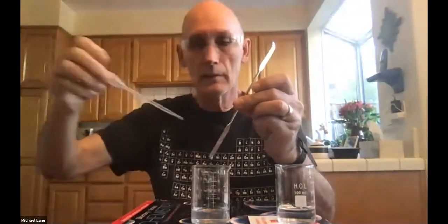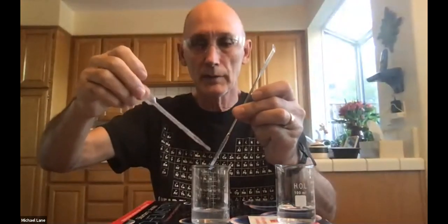Now again, I've got some sodium carbonate that's in that solution. And since everything is based on mass measurements, I want to make certain that I get everything into the beaker that I started with. Okay, start over here. And again, I should have done that. Let me do it now. This is, of course, the sodium carbonate. Now, frankly, I don't recall in the procedure which one it says to add to the other. I can't see that it makes any difference whatsoever.